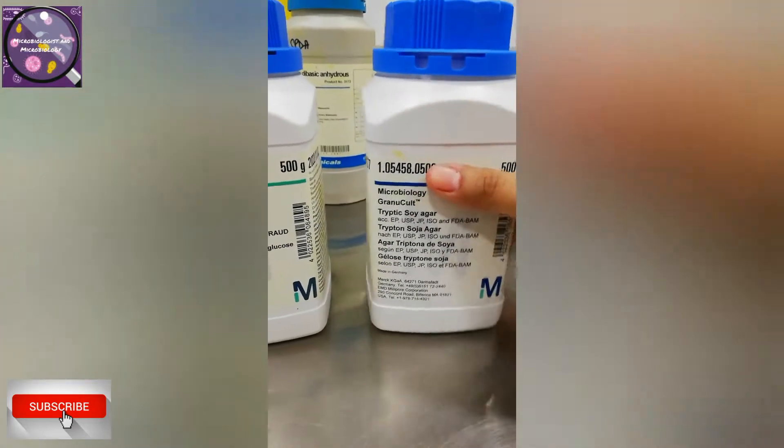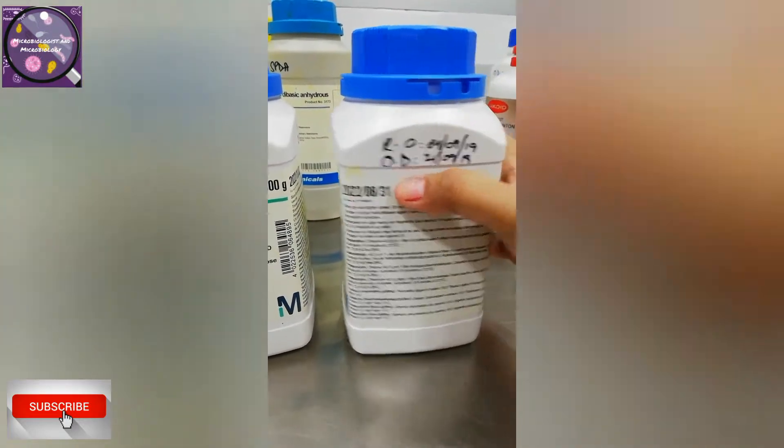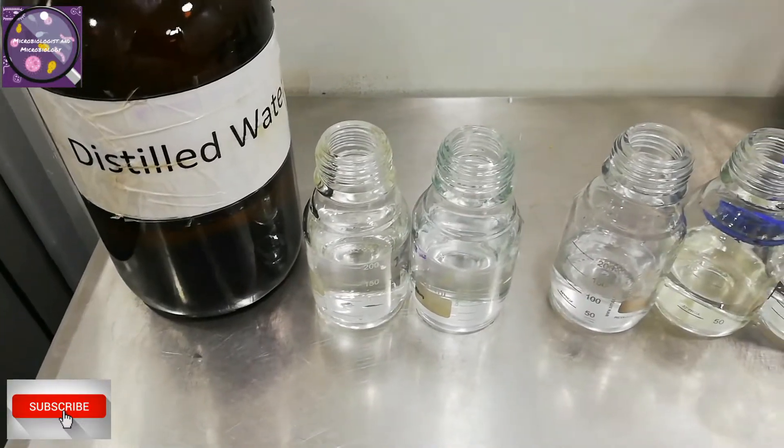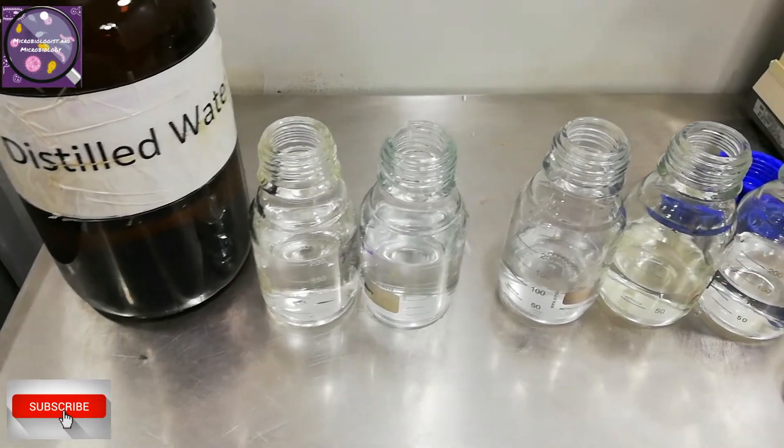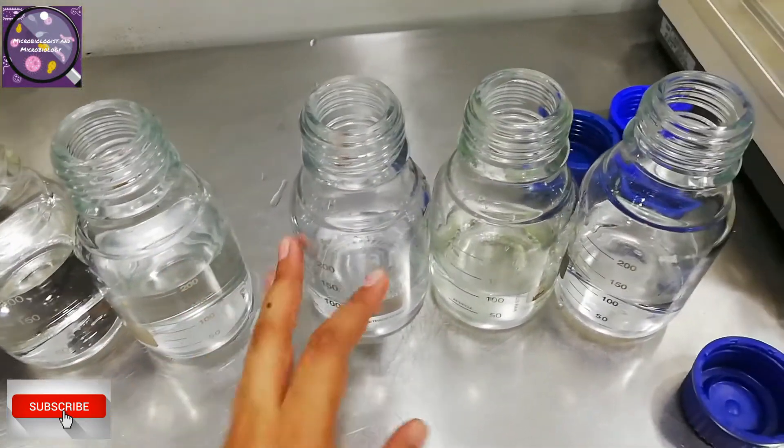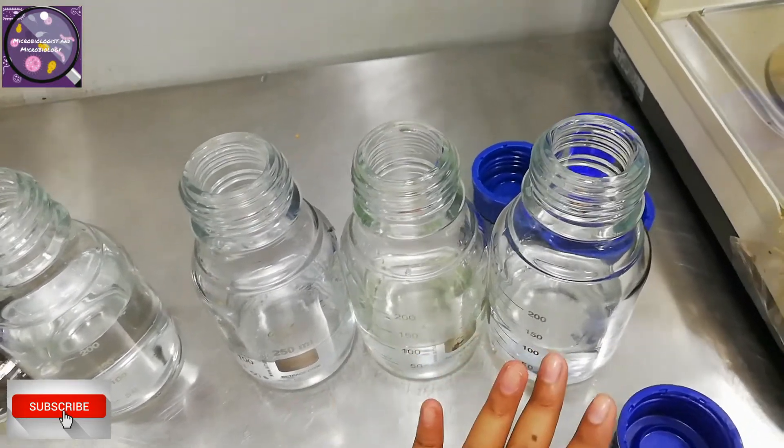Here are different media available for different testing and procedures. I will show the basic SOP at the end of this video. Let's start our work. I am going to prepare media as per my need for today. I added distilled water to each bottle as per my requirement. We can also use deionized water rather than distilled water.